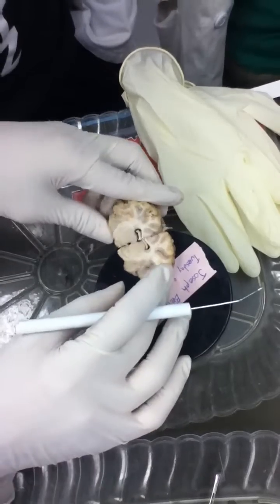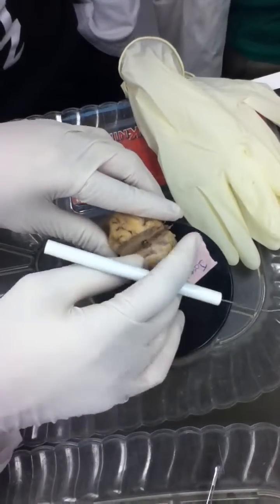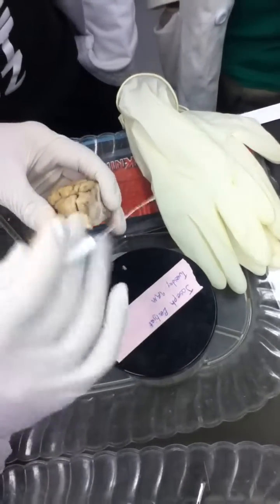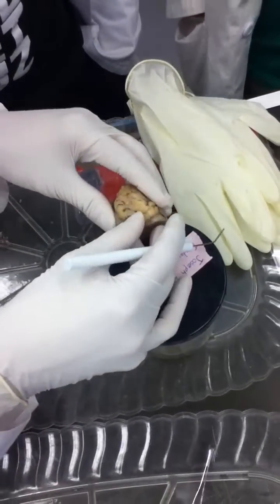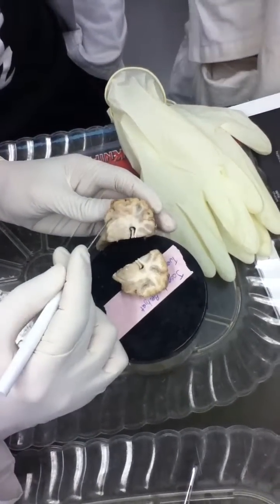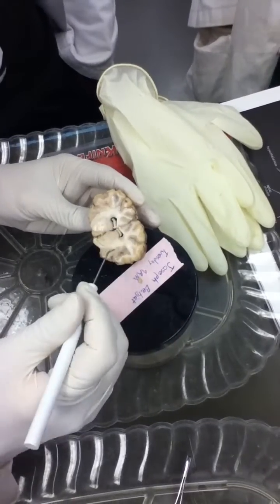Remember I said where did the amygdala live inside of? The uncus. So I told you this is the uncus here. I told you kind of cut it open. So you open it, and you see the amygdala inside there, right there. So that's the amygdala right there.